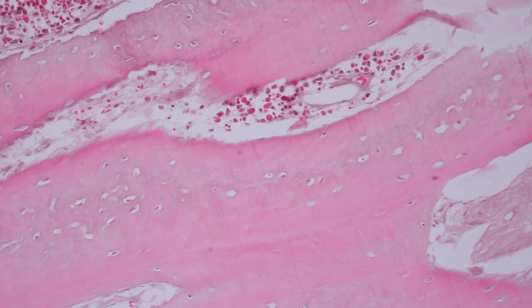Once the growth plates close at the end of puberty, woven bone should not be present in the body, and it's always pathological. It doesn't necessarily indicate the underlying etiology, but what it does indicate is the skeleton or the bone is responding to some type of force in which new bone needs to be made, and it needs to be made rapidly. When you do not see lamellae, you can generally make the assumption that the bone is woven.